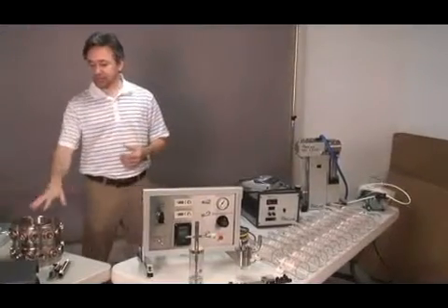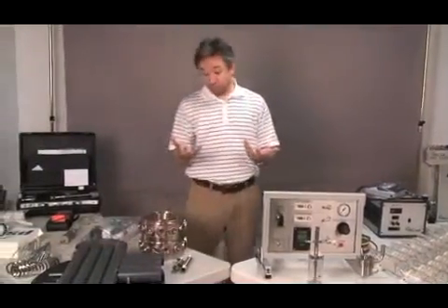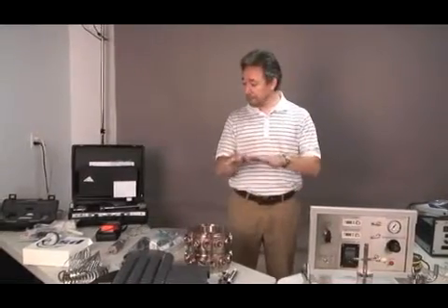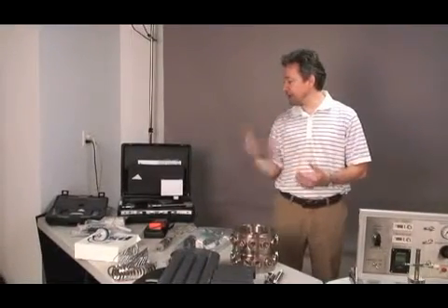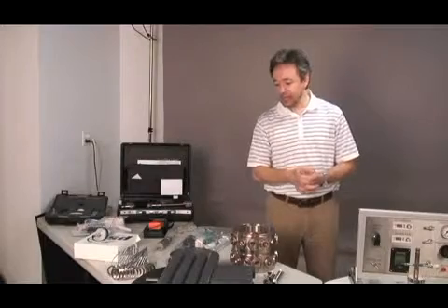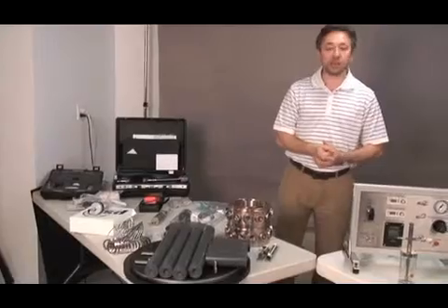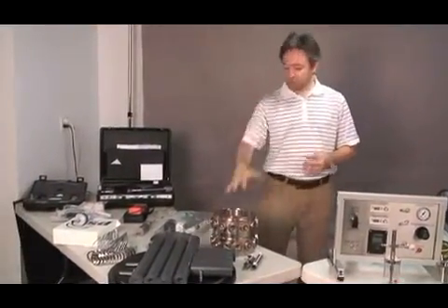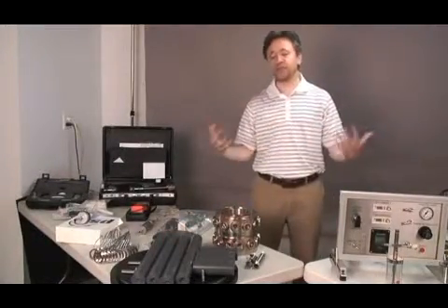The tower sits on top of a rotating table, and I would really like you, when you receive the shipment, to lay out everything, open them, check the status after the transport, and make sure that everything is in good condition, and basically make an inventory and check the packing list of the system, make sure that nothing is missing.